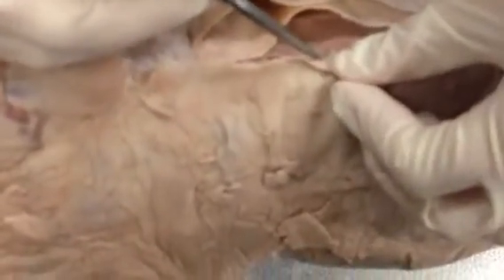And then if you feel the spinous processes of the vertebrae, and you look deep to the erector spinae, you'll see the multifidi muscles running along here, and they run in between the vertebrae, underneath all of this white fascia. So those are the epaxial muscles of the caudal region, and then the ones here were the hypaxial muscles.